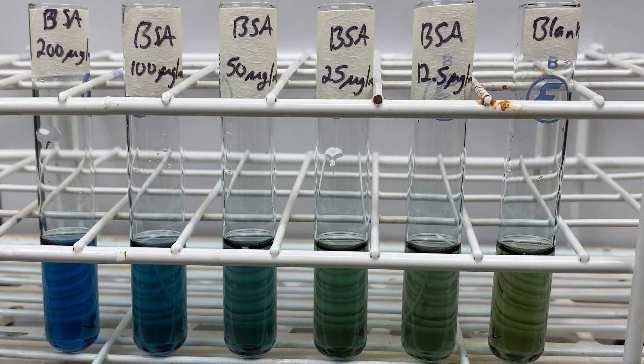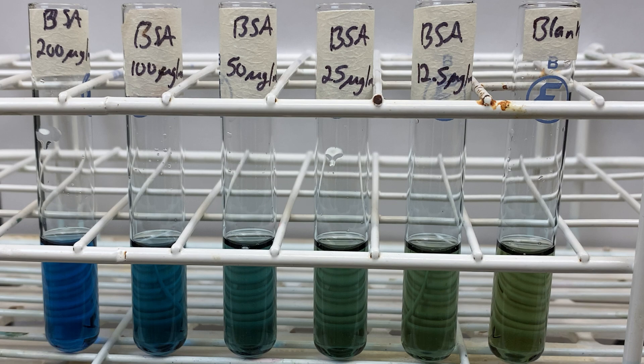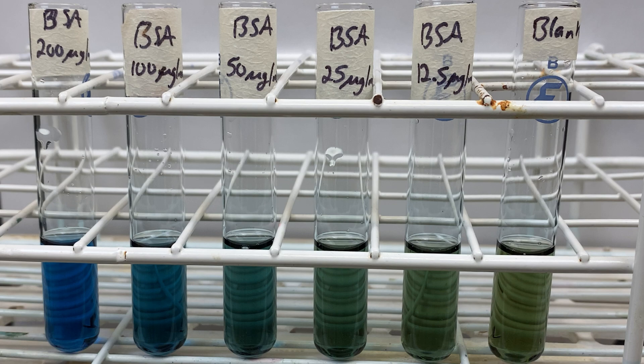This is a common technique used in the industry. There are other standard curves involving proteins you can use. In an earlier video, I showed the Biuret assay. This again is used to quantify proteins. The advantage of the Bradford assay is that it is much more sensitive, going down to one microgram as opposed to one milligram with the Biuret assay. In addition, the Bradford assay is relatively easy to perform. It has a quick turnaround time, and there are few contaminants that can skew your data. One drawback is that the reagents used in the Bradford assay can stain your test tubes. As a result, you may not be able to use those test tubes in future experiments.